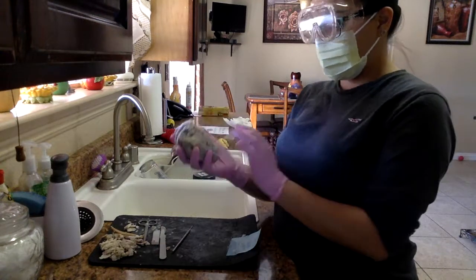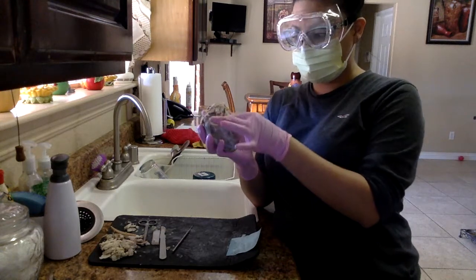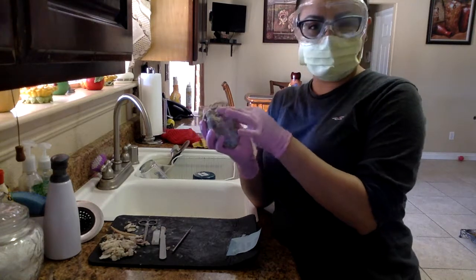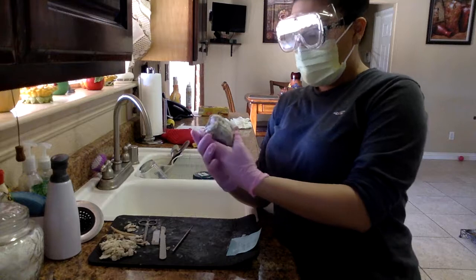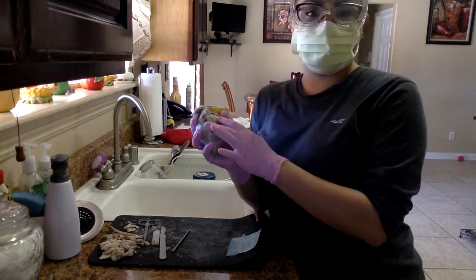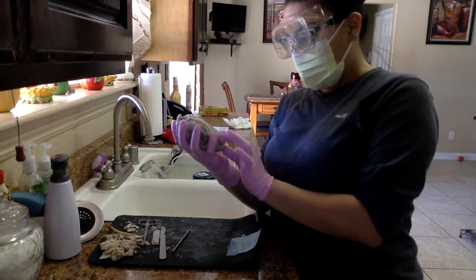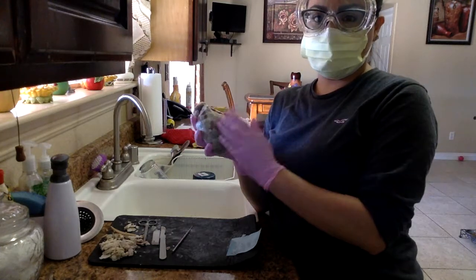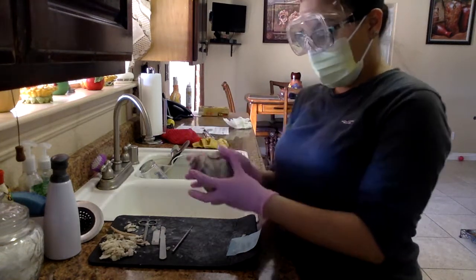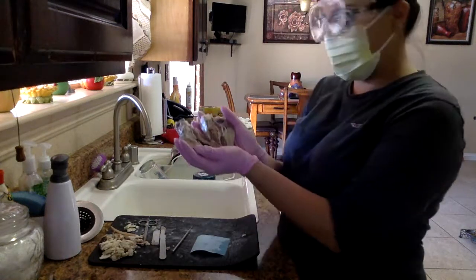So on this side, we can see that this is the posterior part of the sheep heart. You can tell because it has a bulky side to it. That's how I can tell the back of it. And in the front here, it's more smooth. In the front, we have the anterior interventricular sulcus, which is the line that goes in between the sides of the heart, the anterior portion of the heart. So I've also cut it in half here. It's not the best, but it works.